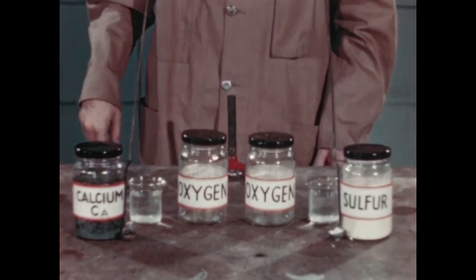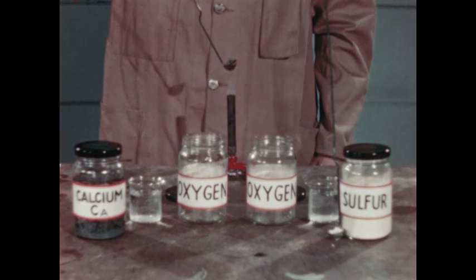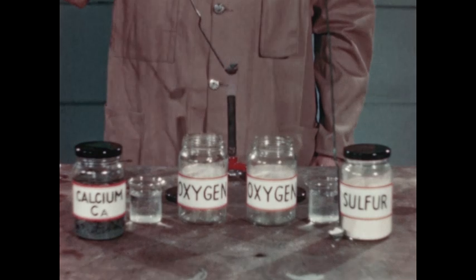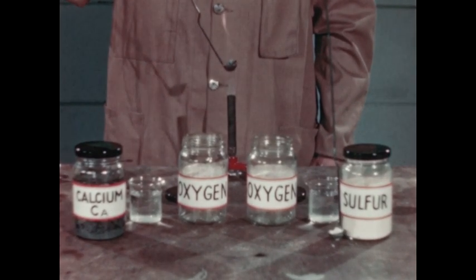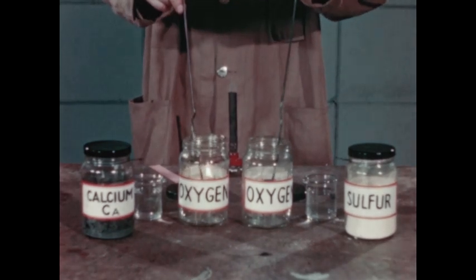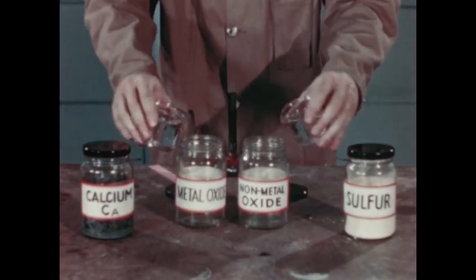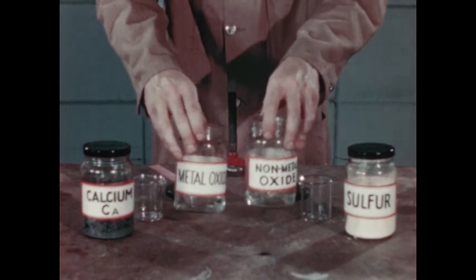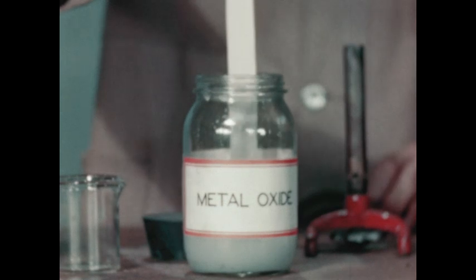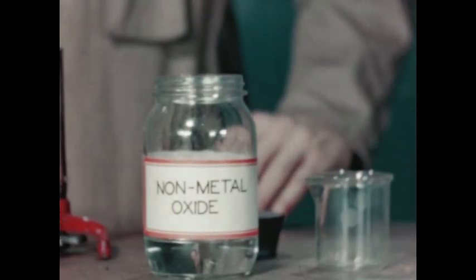We have decomposed compounds to release elemental oxygen; now we shall make compounds, or oxides, by chemically uniting pure oxygen with another element. First we ignite a piece of a metallic element, calcium, then a non-metallic element, sulfur, and let both burn in pure oxygen. Chemically, the oxygen is uniting with the burning elements to form oxides. We find that these oxides are soluble in water, and when we test with the indicator litmus, we discover that metal oxides dissolved in water give basic solutions, while non-metal oxides like that of sulfur give acidic solutions.